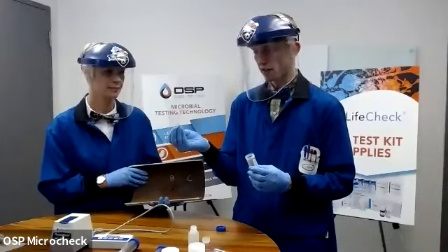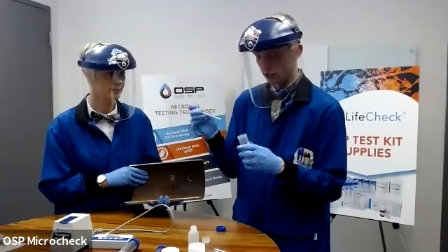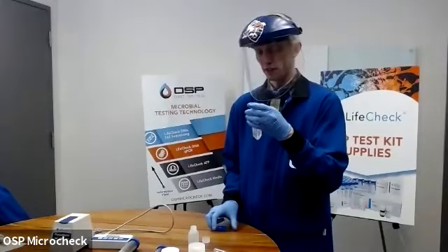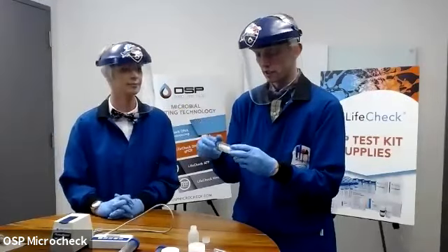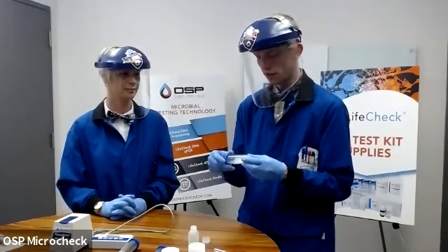Right. So now that I have my swab here completed, I'm going to take one of my Reagent X tubes, place the swab in it, and just carefully snap it off in such a manner that I can replace the lid and allow this lysis agent to cause its effect and release ATP from cells over that 10-minute period.